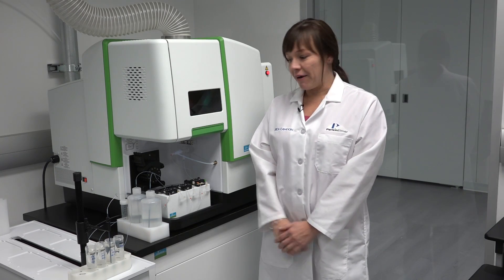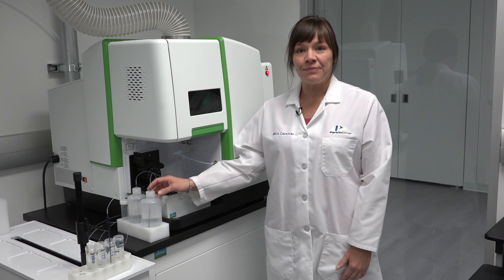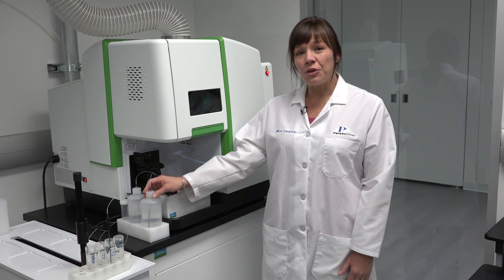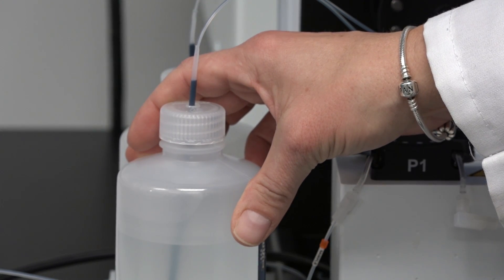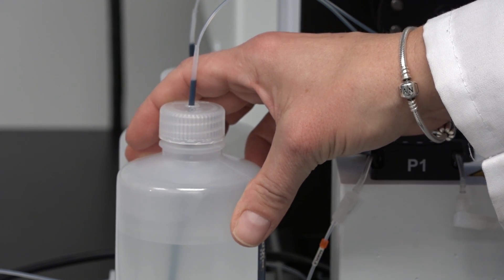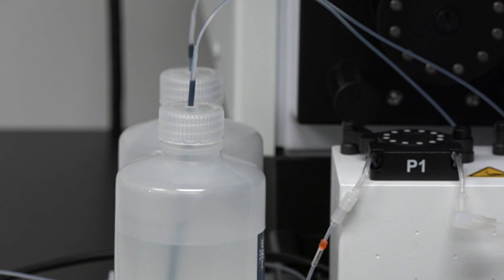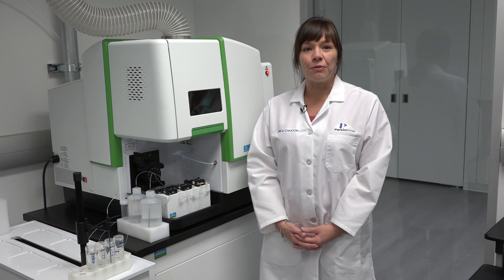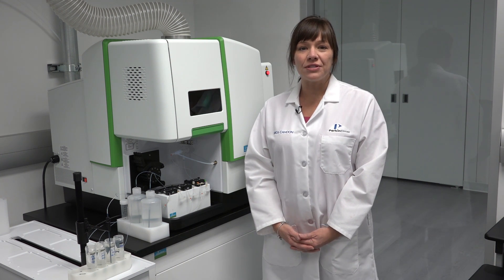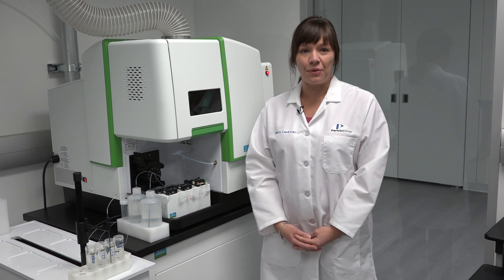You will need to prepare a diluent. This is usually 1-2% nitric acid, or you can matrix match this to your sample. You will also need to prepare an internal standard. The internal standard will be added to your blank, your standards, and all of your samples at the same ratio.